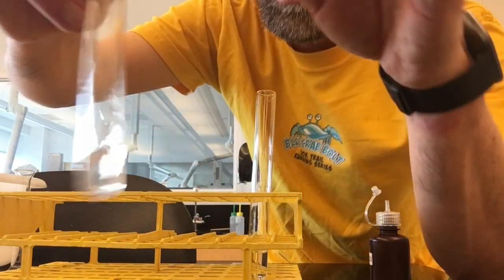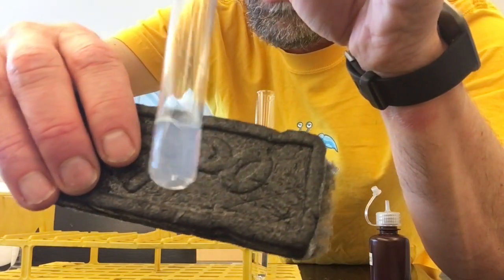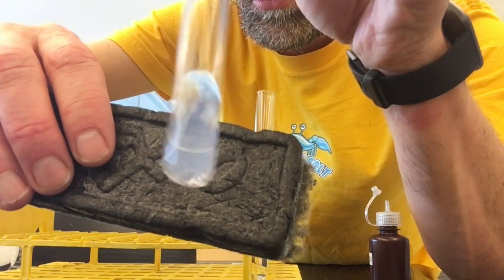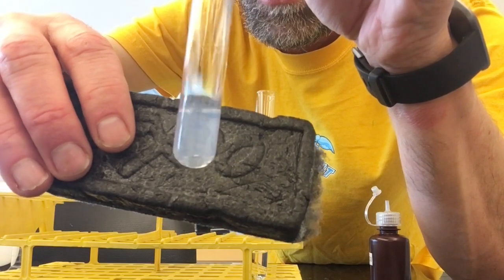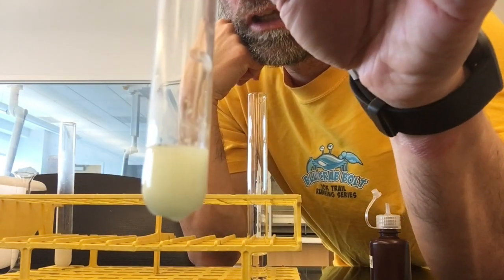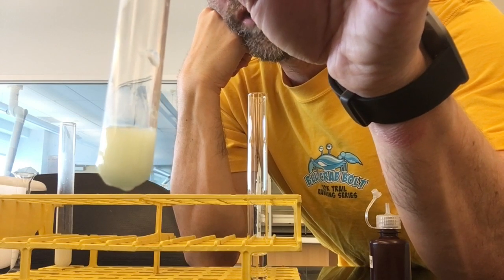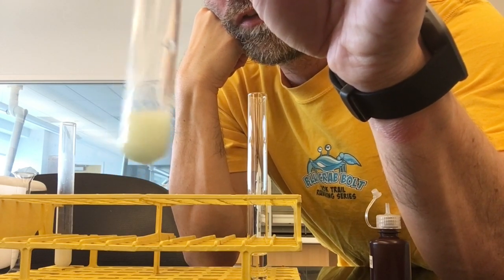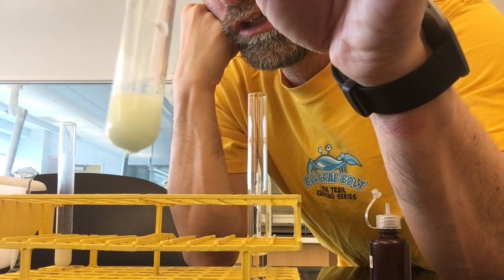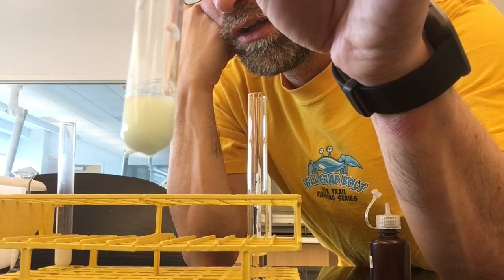Let's check on the 2-bromopropane again — you can see it's getting even more cloudy. So it's reacting. It didn't react instantaneously like the t-butyl chloride, but it's definitely reacting faster than the bromoethane. To prove that the bromoethane would eventually react, I mixed the two before in a hot water bath, and you can see after heating it, bromoethane does react with silver nitrate.